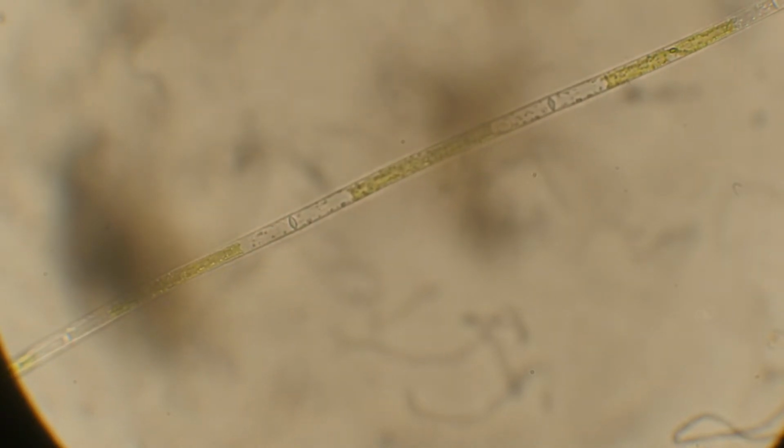So now let's go through all 4 objectives, back to 4X, bright field. There we are. So there's our algae way down there. So now we're back to a larger field of view. The cameras are sitting up there on top of the MTV3, so there we go. Hopefully it won't fall down. But that's our algae right there at 4X D-plan.